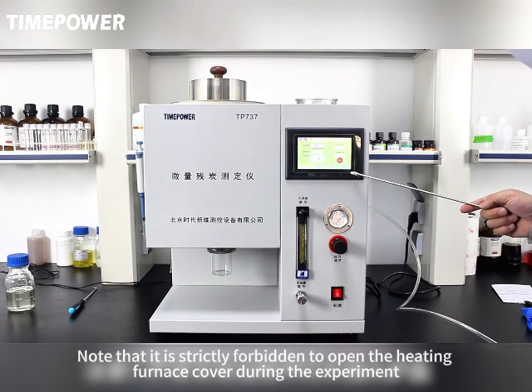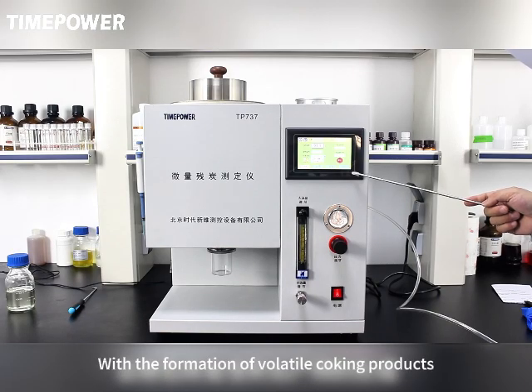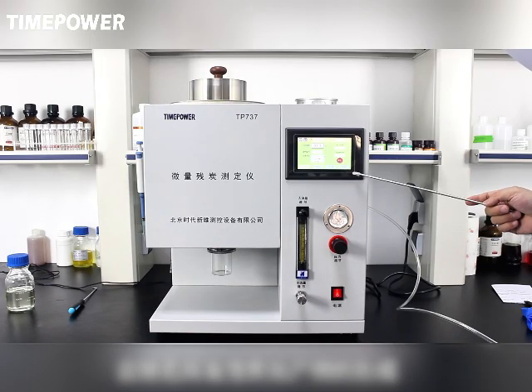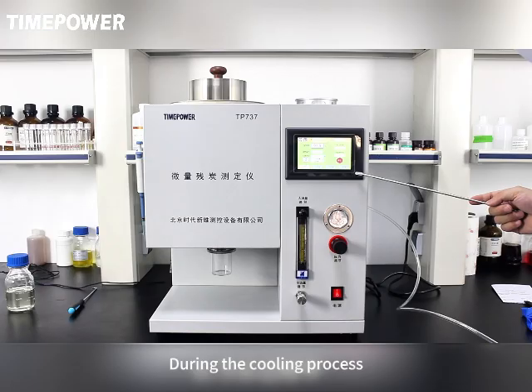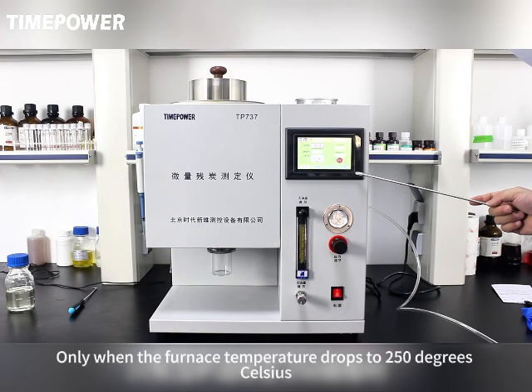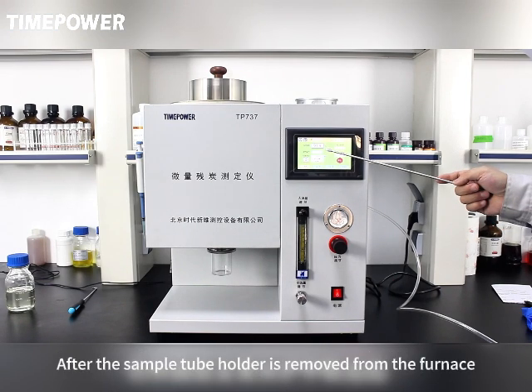Note that it is strictly forbidden to open the heating furnace cover during the experiment, due to the introduction of air or oxygen with the volatile coking products. This produces an explosive mixture and is prone to combustion or explosion hazard. During the cooling process, only when the furnace temperature drops to 250 degrees Celsius can the lid be opened.